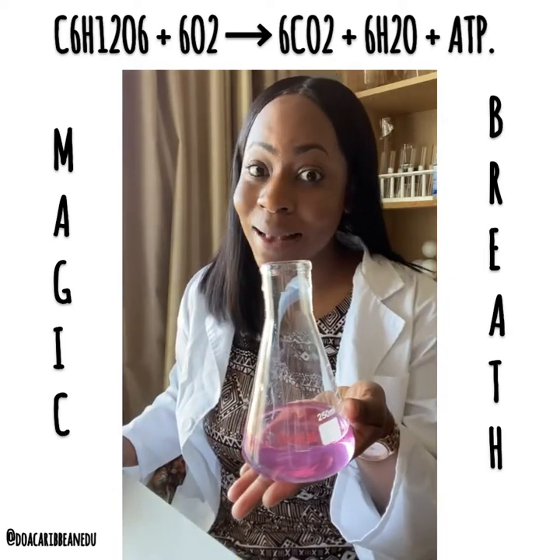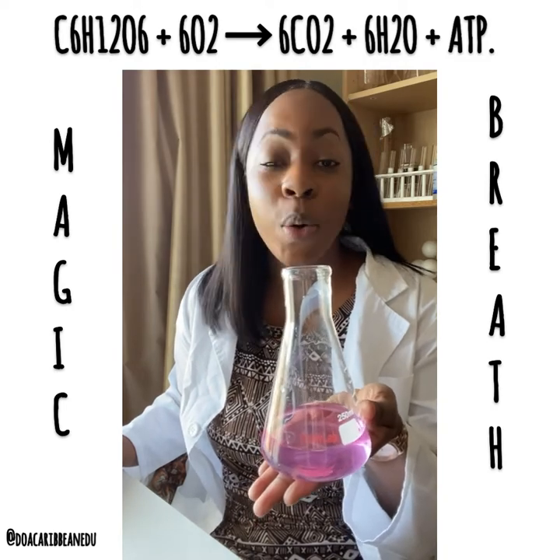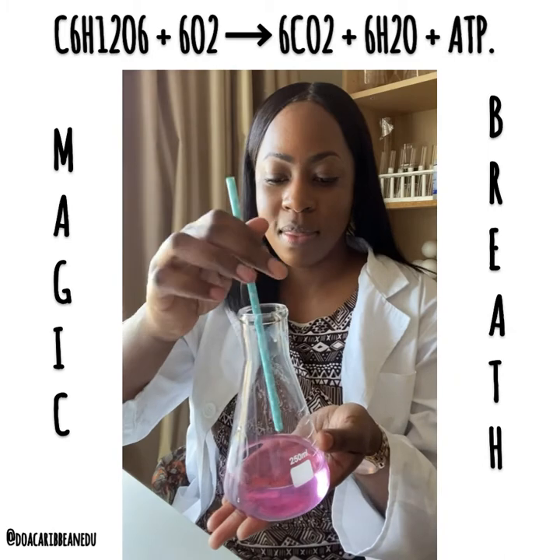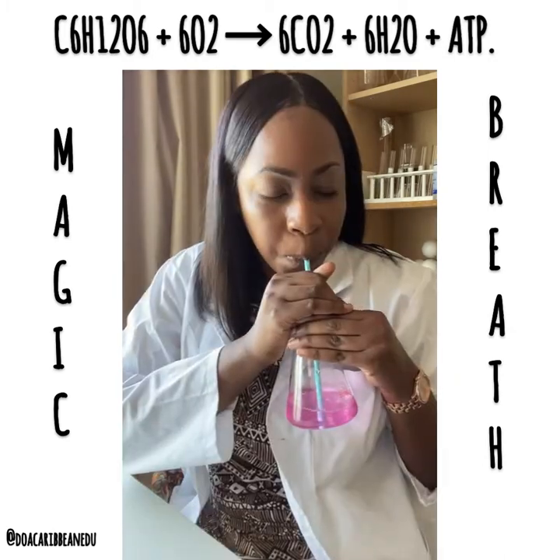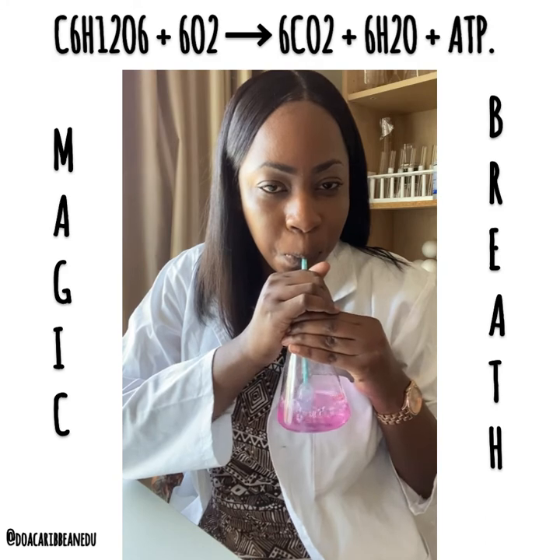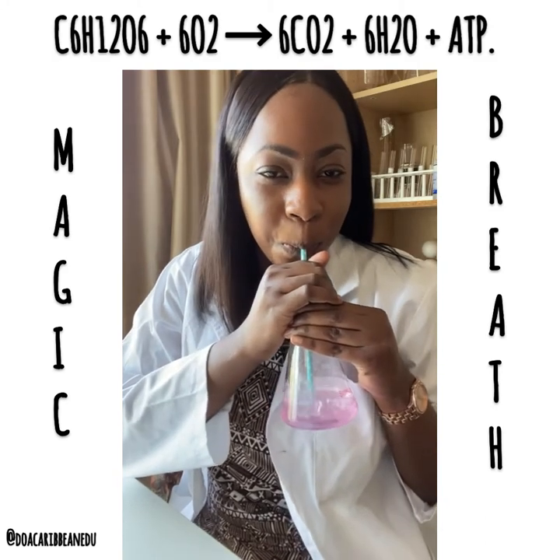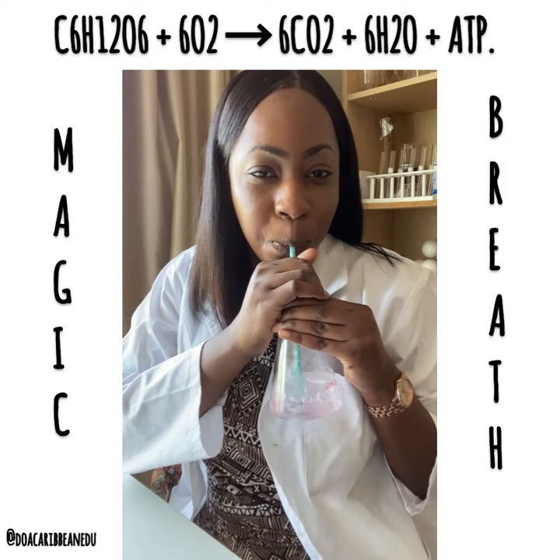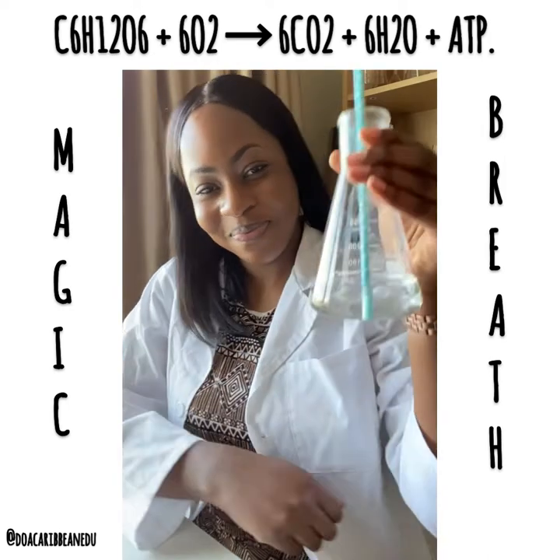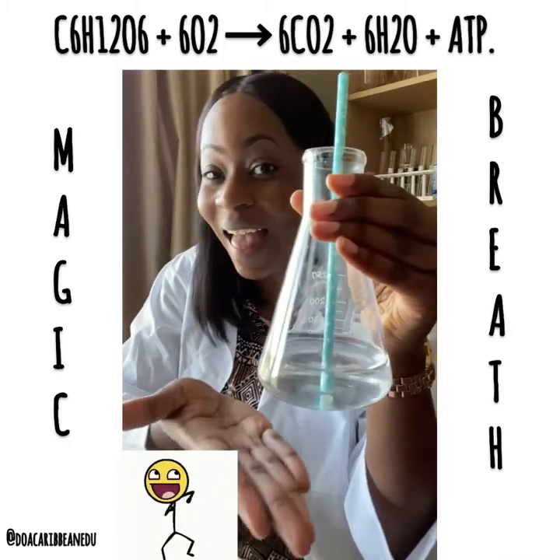I am now going to exhale into this phenolphthalein solution and you are going to note any color change. Here is the result — you have colorless.